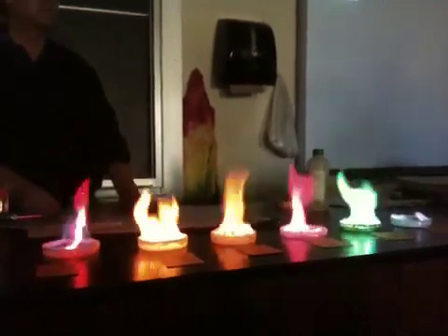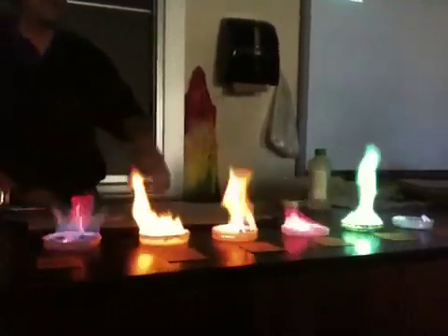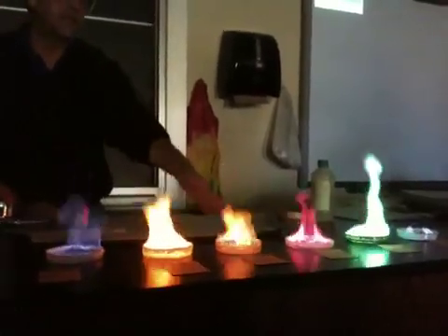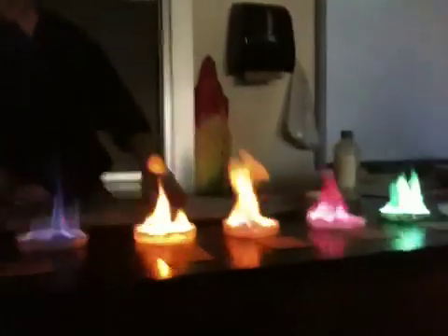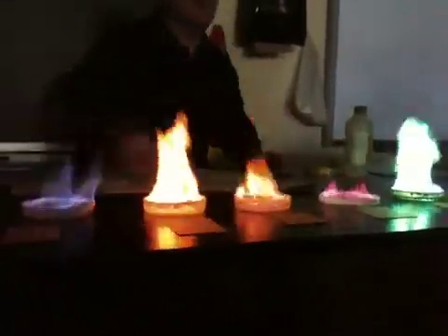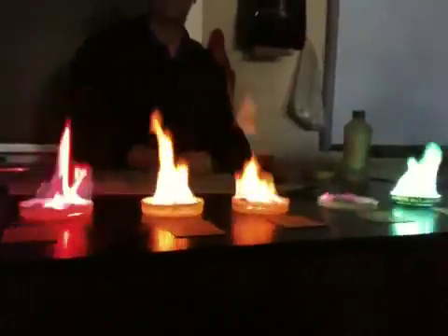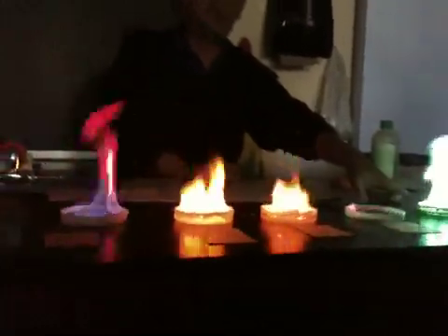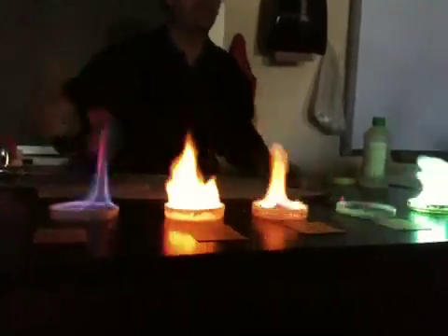When they fall back to the ground state, they emit energy, and that energy happens to be equal to the color of yellow light. When calcium does it, it's not quite as yellow — it's a little more orange. When lithium's excited electrons fall back — so which one of these colors would have the most energy associated with it? The potassium, because it is purple. The second would be green — the copper. The least energy would be lithium, because it has a longer wavelength and less energy.